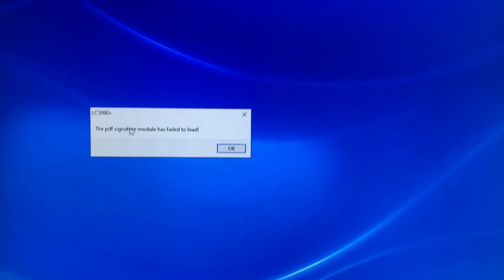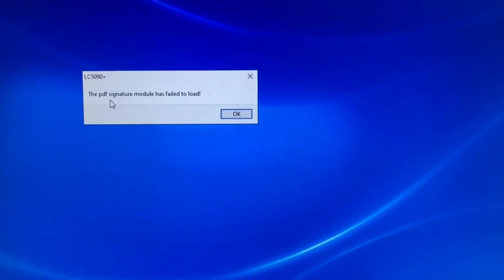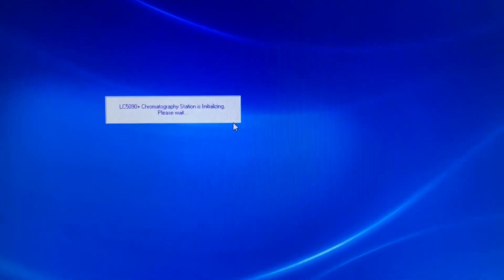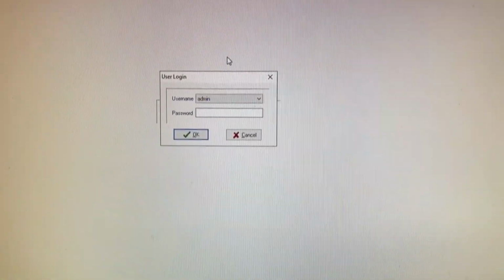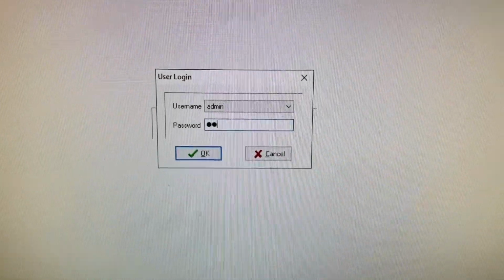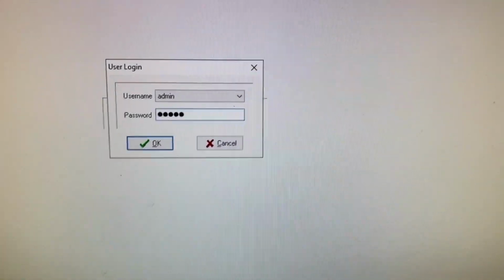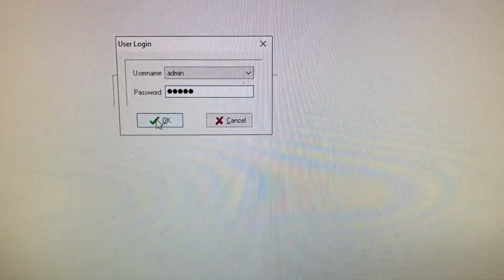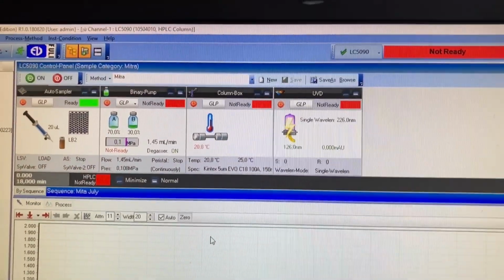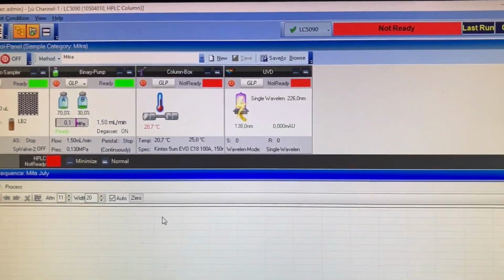I haven't actually had this running for a few weeks. She's a bit slow to get going. It'll say the PDF signature module has failed to load. Don't worry about that, just push OK. Oh, good. Back in action. Yeah. Admin. Admin. Okie dokie. There we go. Software has found the machines.